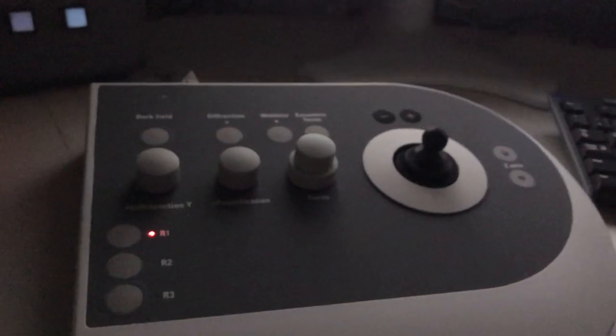Okay, so I have the dark field button off, and my objective aperture centered around the direct beam and only selecting the direct beam. So I have the condition for a bright field image. So I'm going to go back here and go into image mode. Okay, so you can see the bright field image now on the screen, and I'm going to resize my area of illumination with the intensity knob, so I'm a little bit bigger than that 40mm circle.